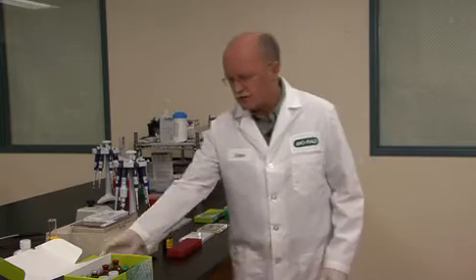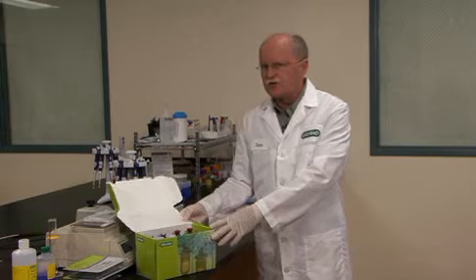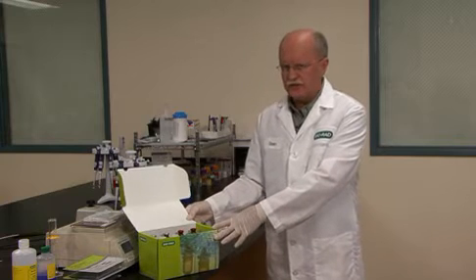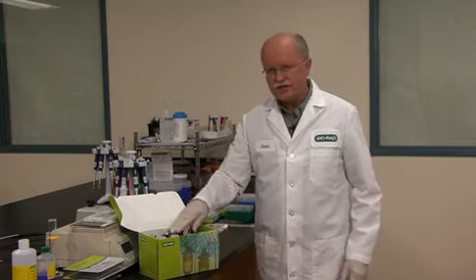After sample preparation, the first step to 2D is to rehydrate the IPG strip. I'm going to demonstrate this process using Bio-Rad's 2D starter kit. The 2D starter kit is a great tool for learning 2D gel electrophoresis. It contains all the reagents and an E. coli sample for running a 2D gel.